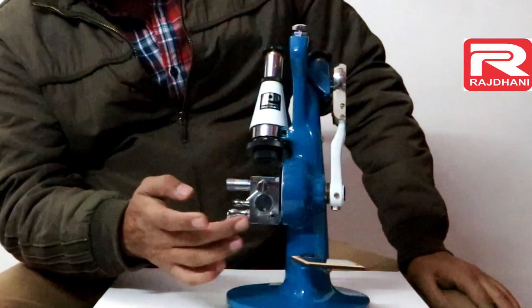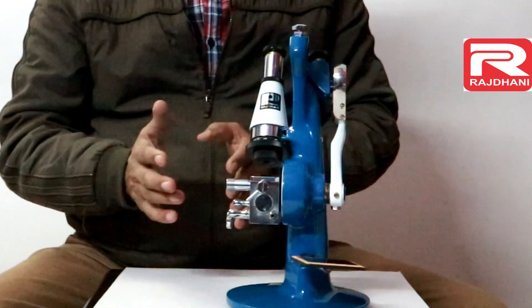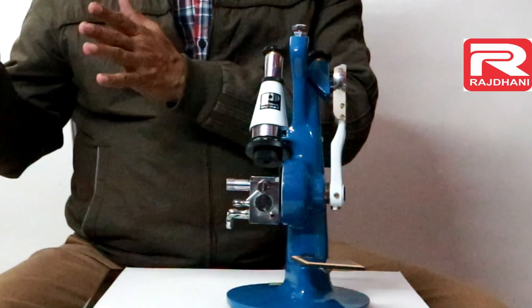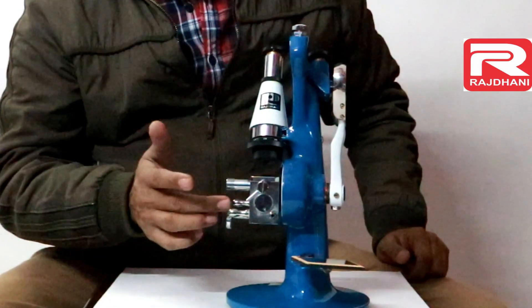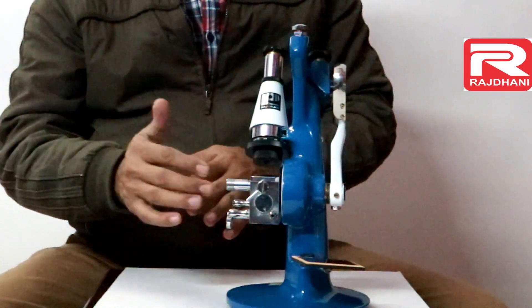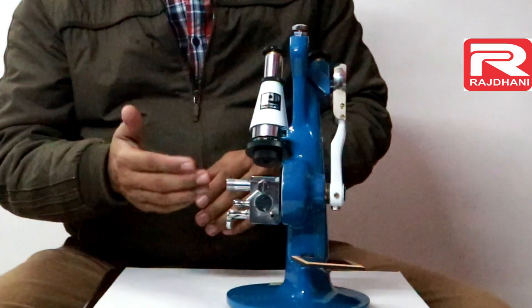Now these are the nozzles — there are four nozzles: one, two, three and four. These four nozzles are used when this instrument is connected with a constant temperature circulating water bath. Suppose you want to test a sample at a particular temperature; then we connect the circulating water bath with this instrument through these four nozzles for the input and output water of that water bath.